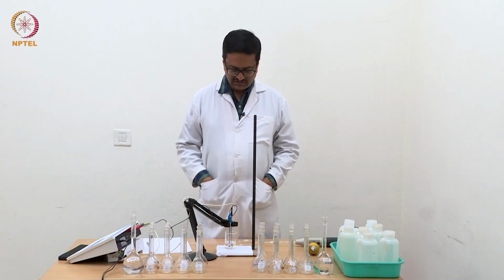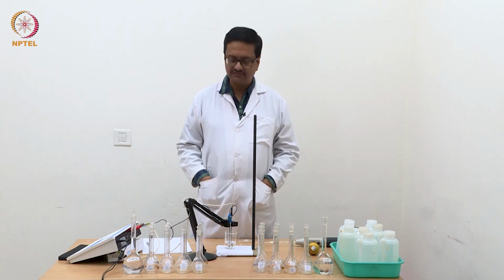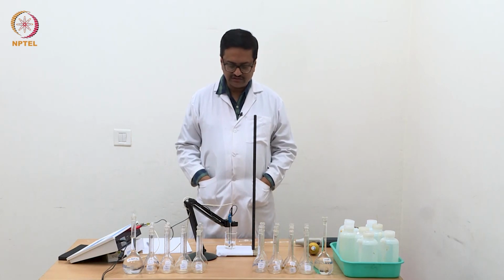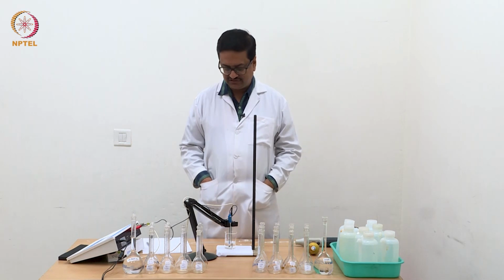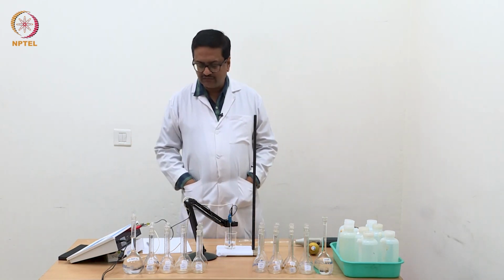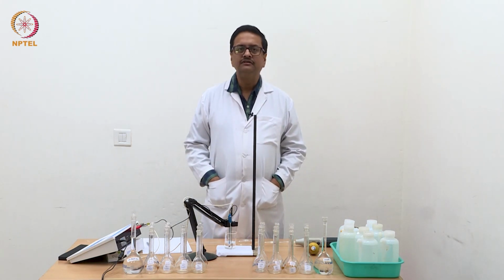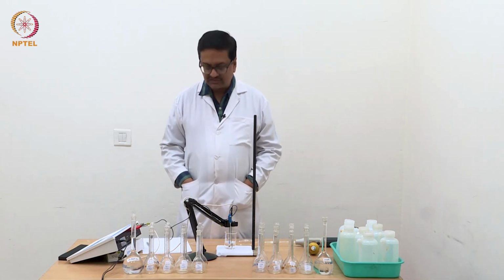Welcome back to this experimental session of the elementary electrochemistry course. By now we have demonstrated experiments related to potentiometric titrations and conductometric titrations, and now we have got ready with another experiment where I am going to show you the variation of conductance with concentration.